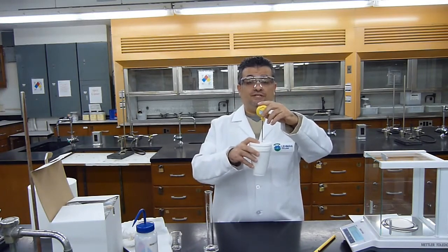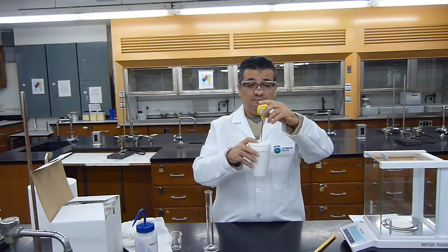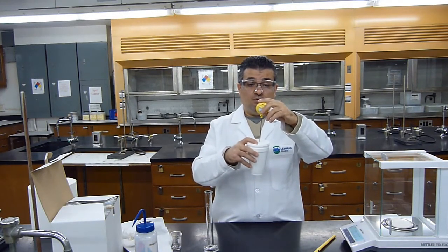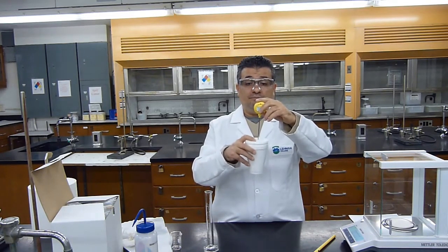My temperature is increasing, neutralization is occurring. I am currently at 36.4 and climbing. 37.2. 37.3. Continue mixing.